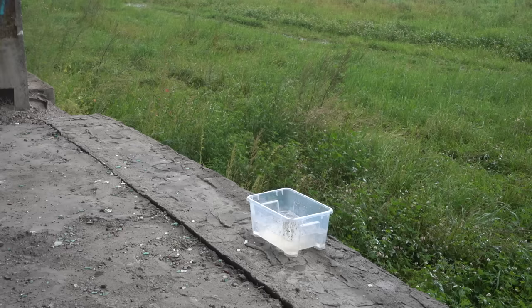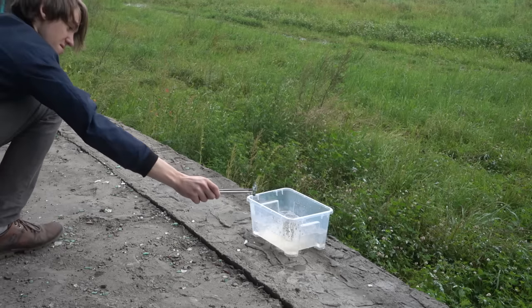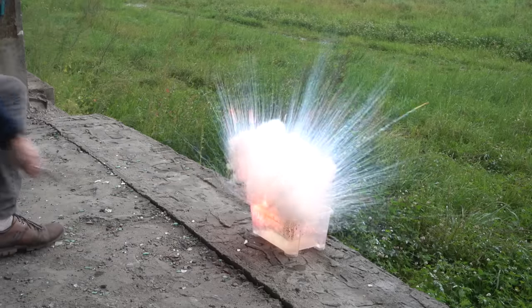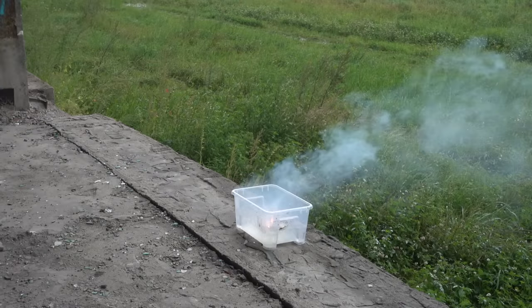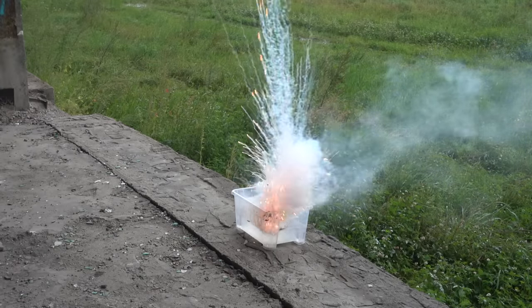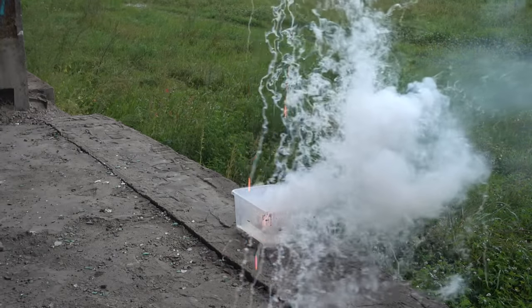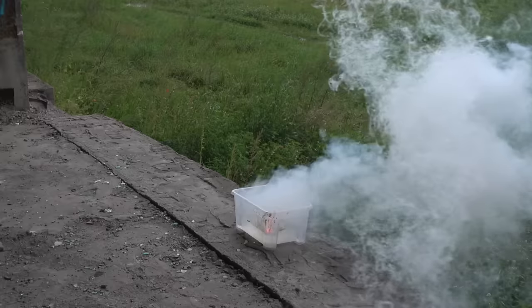Lastly, we decided to throw about 20 grams of cesium in container filled with ice water. As you can see, cesium explodes at the first contact with water, although not so strongly as it's sometimes portrayed in other videos.